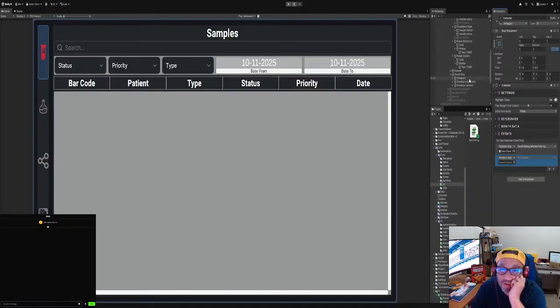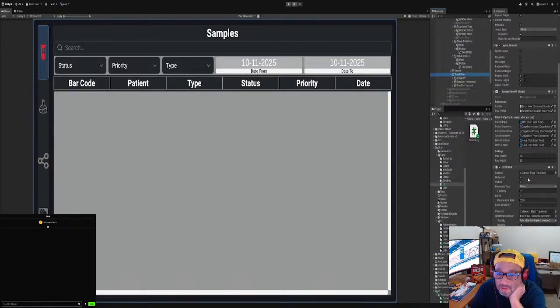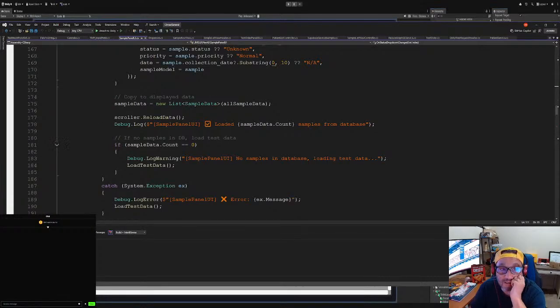So now we're gonna do it here, and now we go back to the sample search list view, I believe. View, yeah, right here, right? And what you're gonna do is, you go to the sample list panel, and you are going to apply filters. I don't see apply filter here, so that means it's a private method. So let's go look for it. Apply filter. Oh, I see. Never mind.